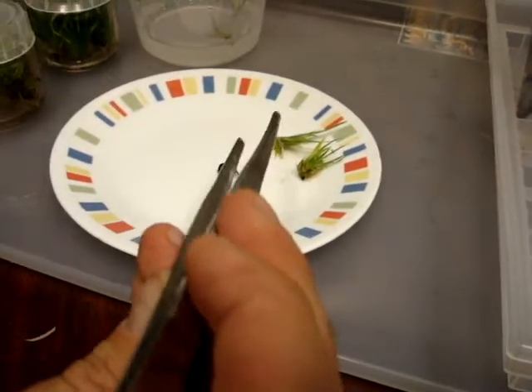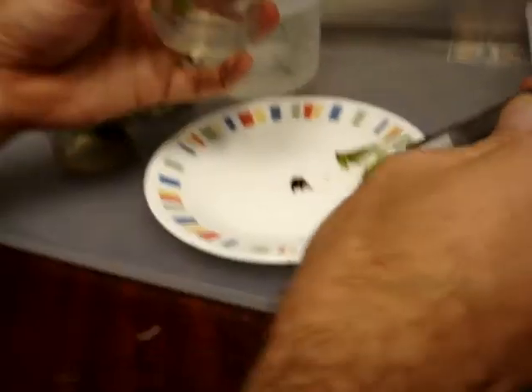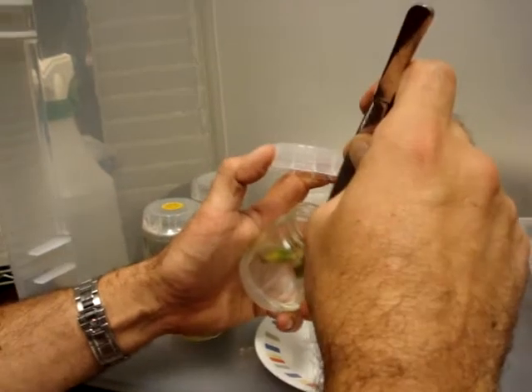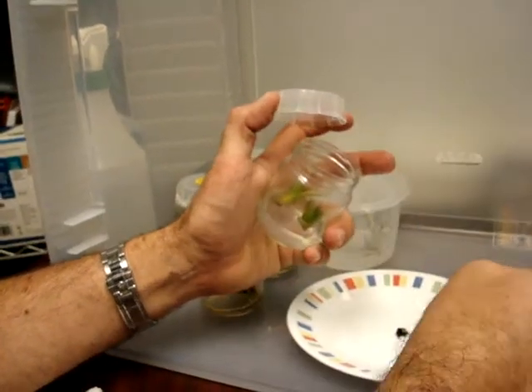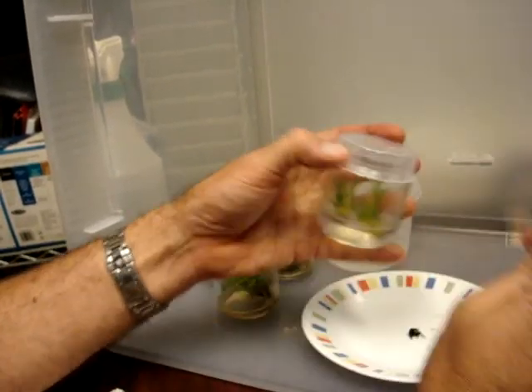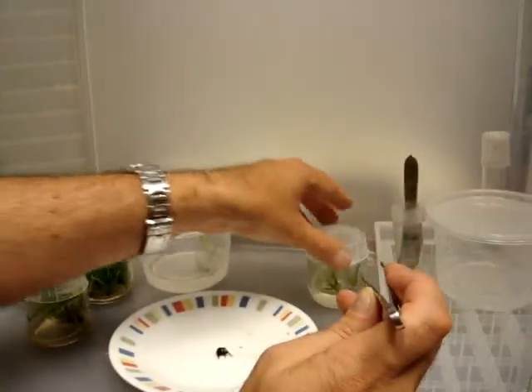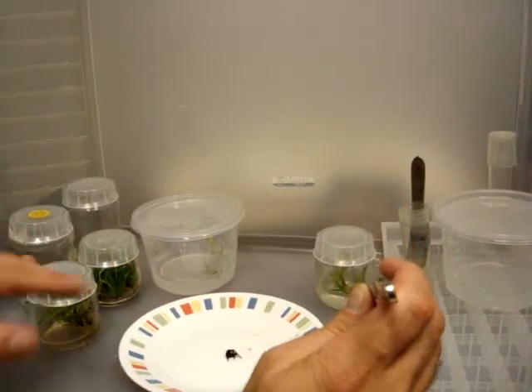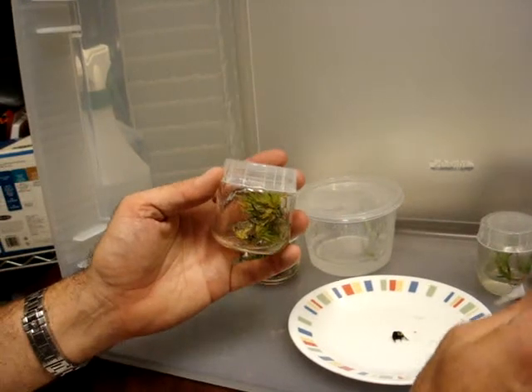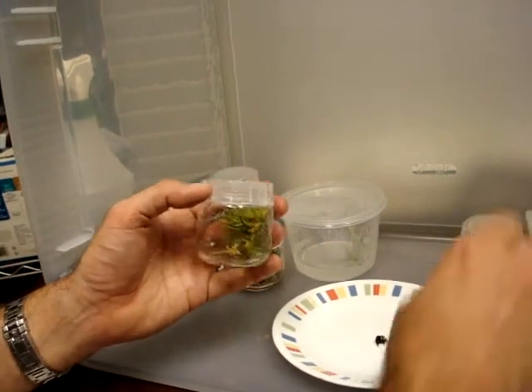Forgive me if I put my hands in the way. We got one. Our goal is three clumps of plants, and this is what is going to grow to fill this jar all over again. So there is our new multiplication jar. Everything else from this jar now can be divided and rooted, and that is where all the multiplication comes from.